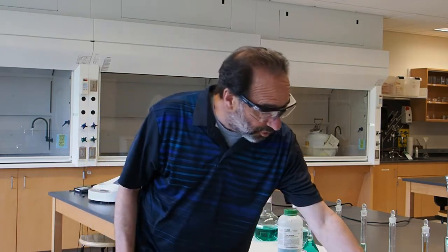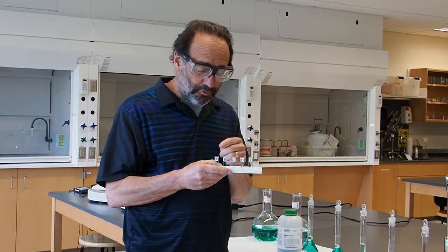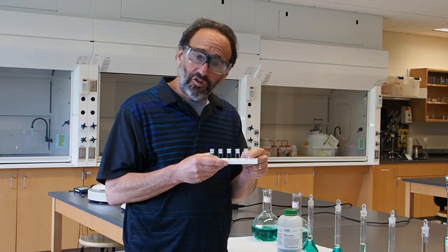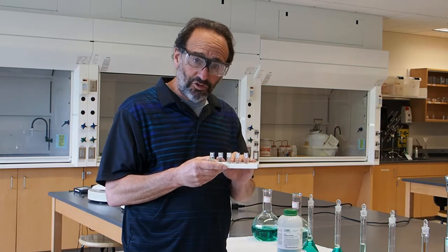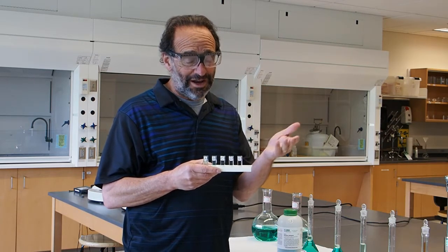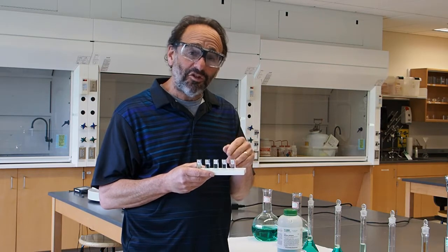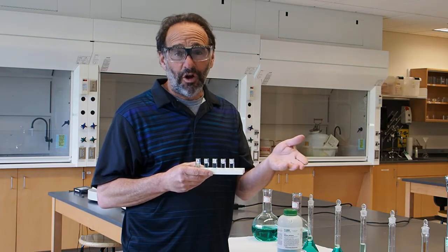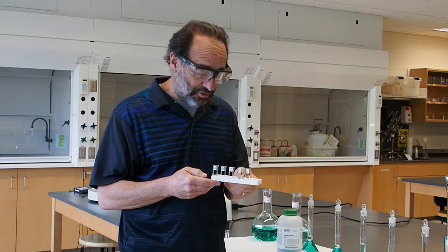We put those in cuvettes. What we're going to do is first measure the absorbance of these solutions using the spectrometer, and use that to make a working curve or standard curve. After we have the standard curve, we'll measure the absorbance of all our unknowns and use that to determine their concentration.